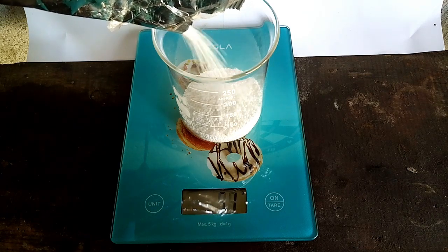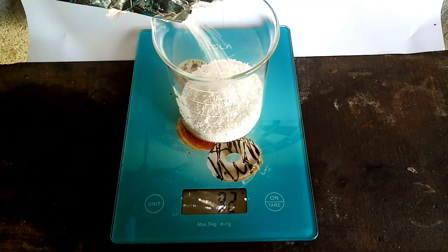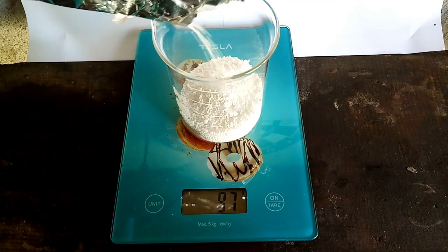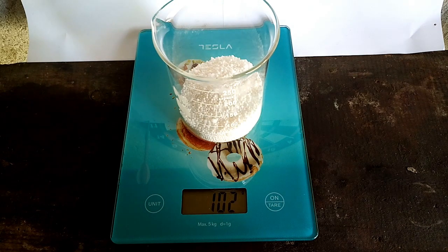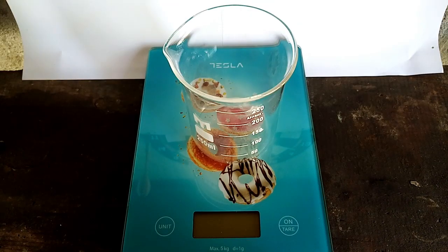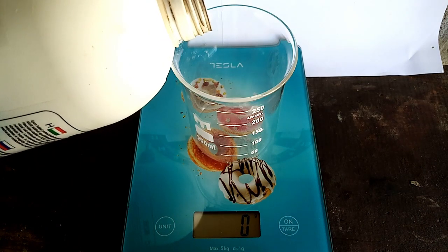Much more calcium nitrate is added to be sure all of the acid will react with it. To make the nitric acid, all you need to do is react the calcium nitrate with a strong acid, and that acid will be sulfuric acid, another very useful chemical in a lab.